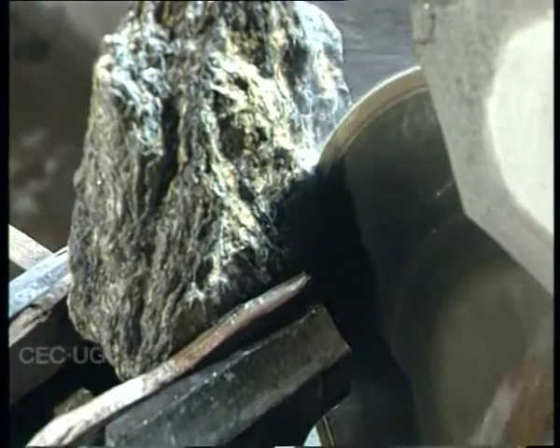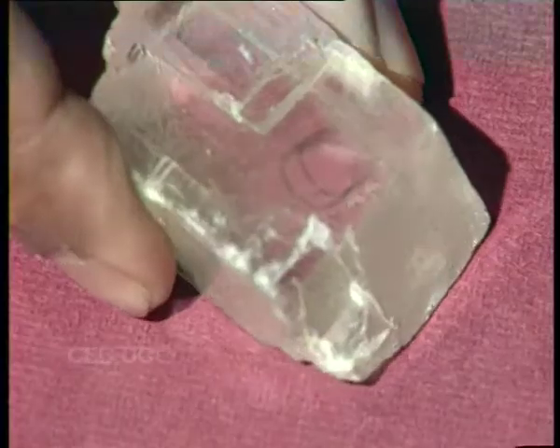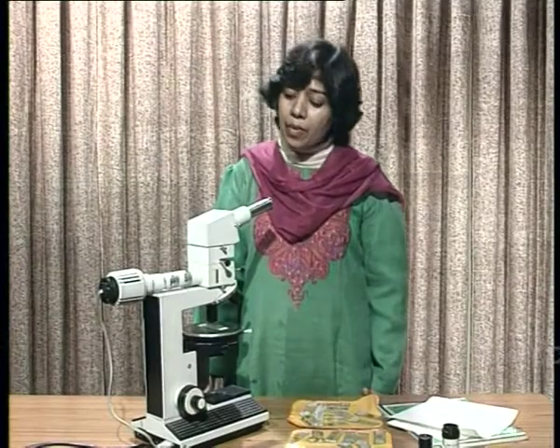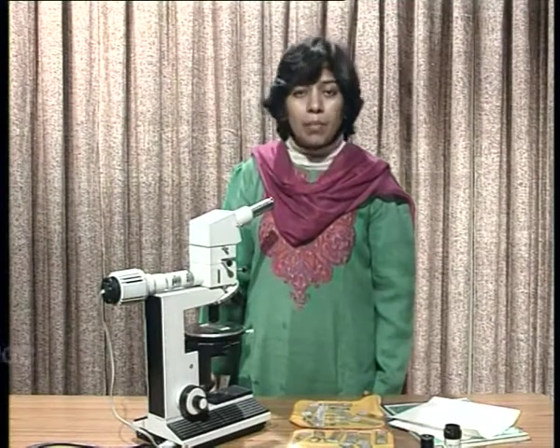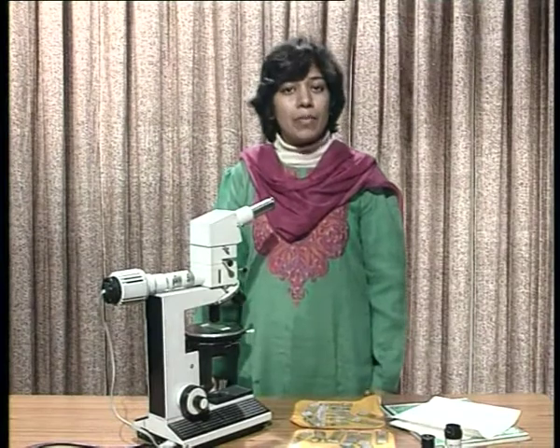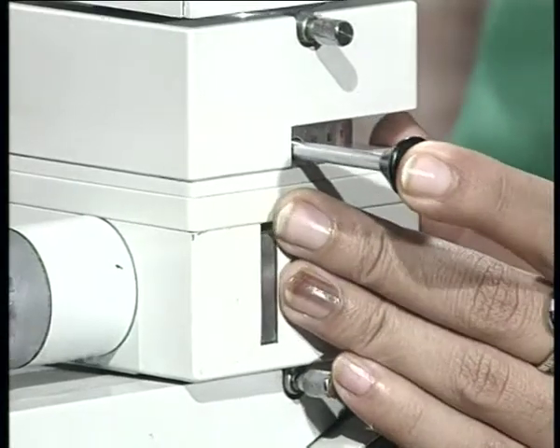We have so far learnt how thin sections of minerals are prepared for microscopic study. We have tried to understand some basic principles of mineral optics. We have also seen the various components of petrographic microscope. With this background, let us now observe some important optical properties of minerals in thin section. We will make these observations in two different modes: in plane polarized light when the analyzer is out of path, and in crossed position when the analyzer is inserted.